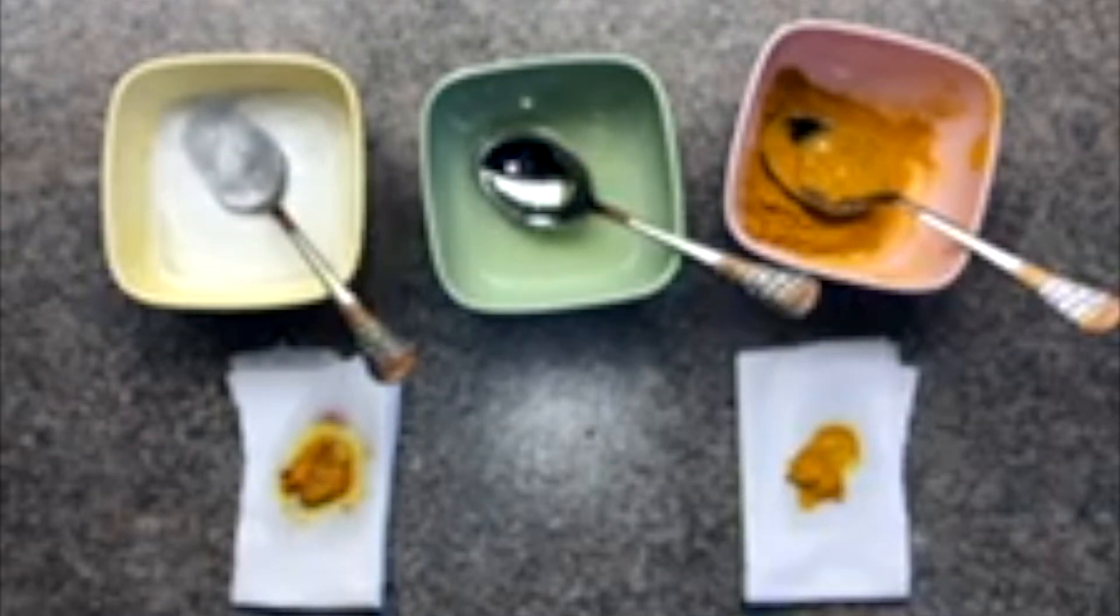The color has changed again. Now these two are looking the same. That means lime water has changed the color of the turmeric.